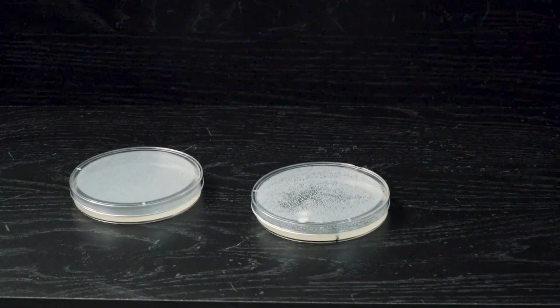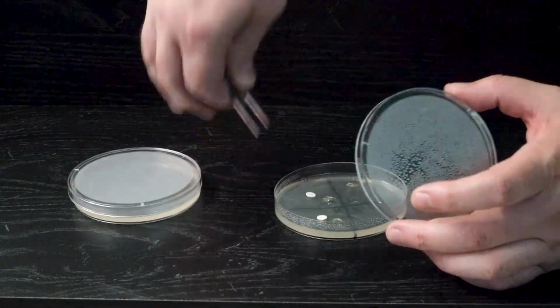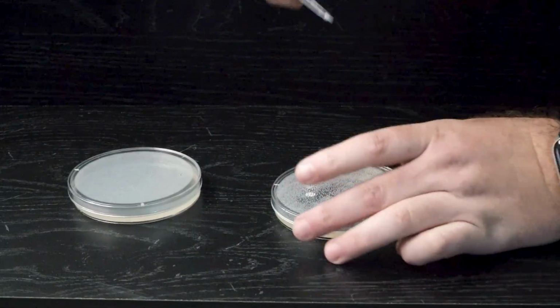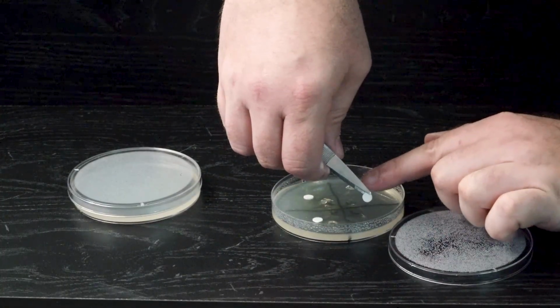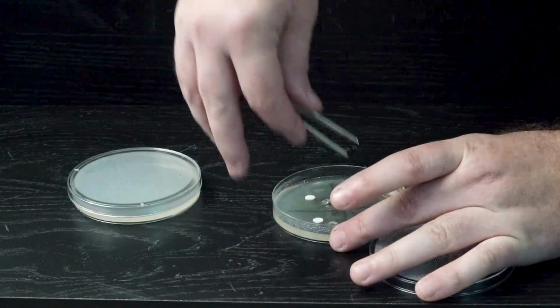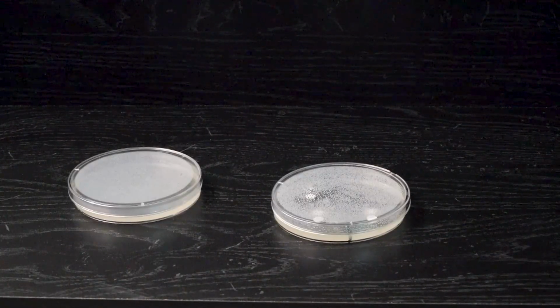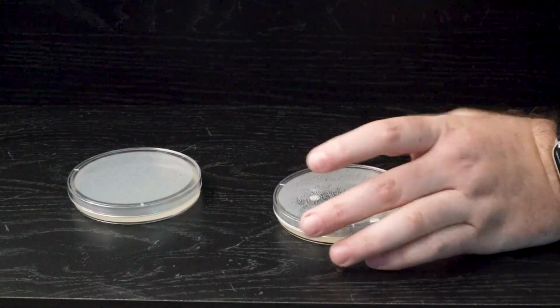I'm going to pick a different antibiotic and add my punch. You can see that one, I didn't quite get it towards the center, so I'm going to adjust it. I do not want to cut into the gel at all, so I want to make sure that I'm as careful as possible. Last one. And that landed almost perfect.